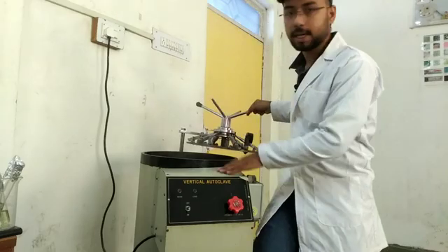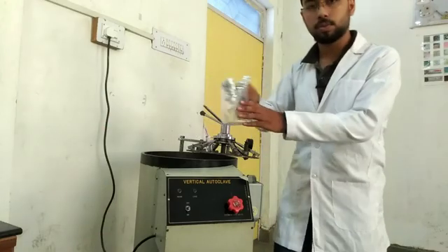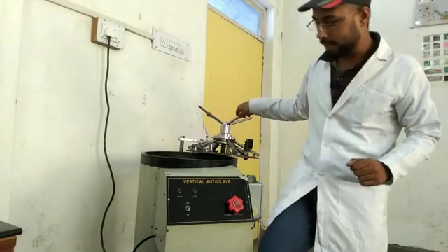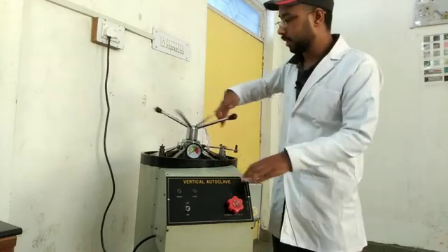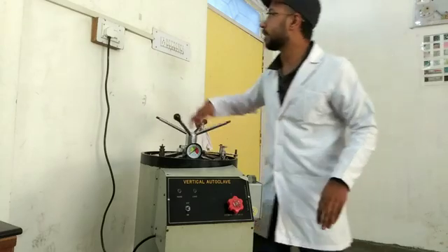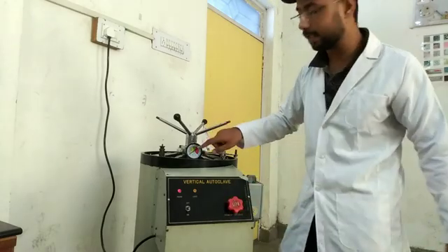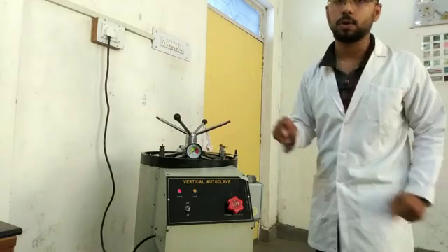The autoclave makes the media sterile. I have preheated the autoclave — you can see the vapors coming out, which means it is preheated. Place the test tubes inside the autoclave, close the lid, close the valve, and wait until it reaches 15 psi. Then maintain for 15 minutes for sterilization.